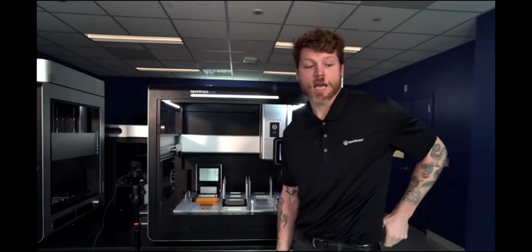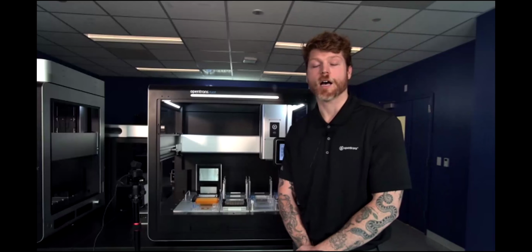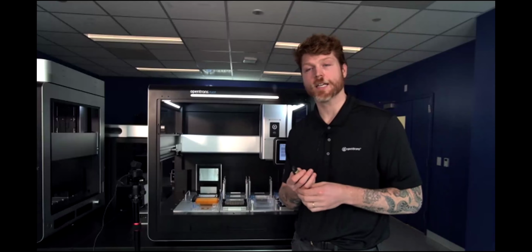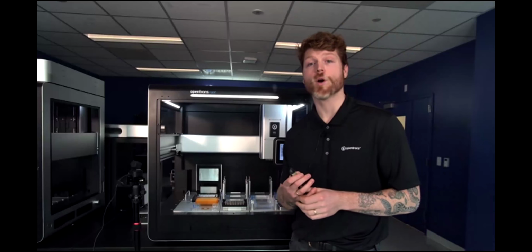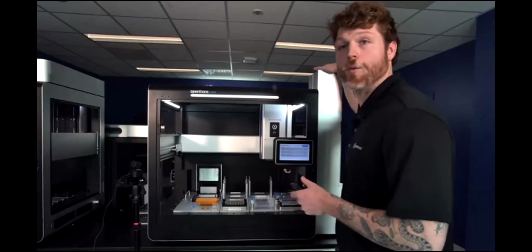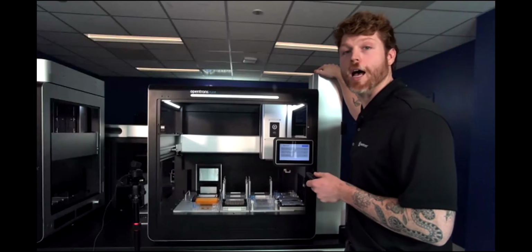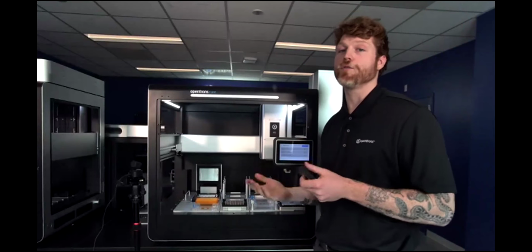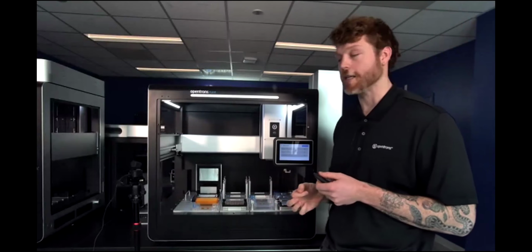Okay, fantastic. The next thing I will be able to talk through here is going to be the Flex stackers, most specifically, as they were highlighted and as Matt pointed out some of the various points for them. For this protocol, we'll be using two stackers. It's difficult to tell in the camera angle, but you can add these on modularly, so you can have up to 4 stackers equipped to a singular Flex instrument.